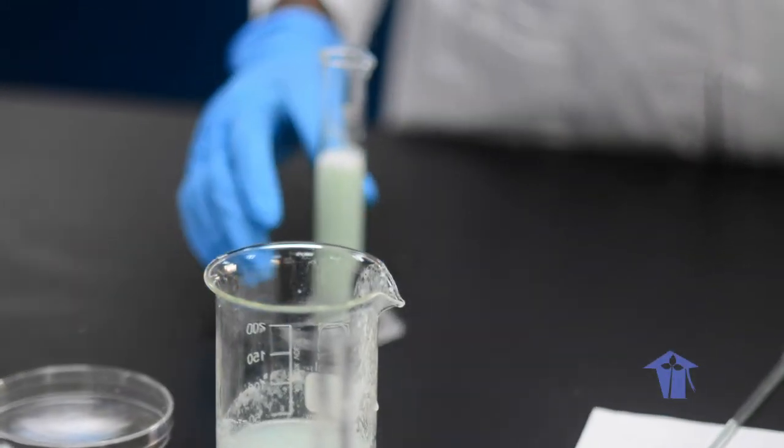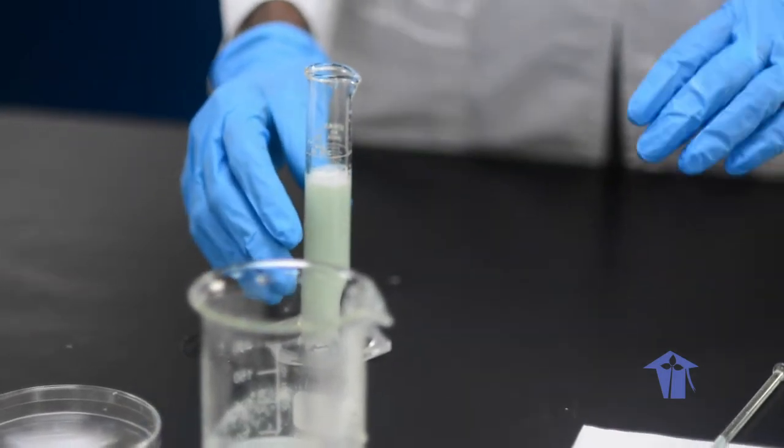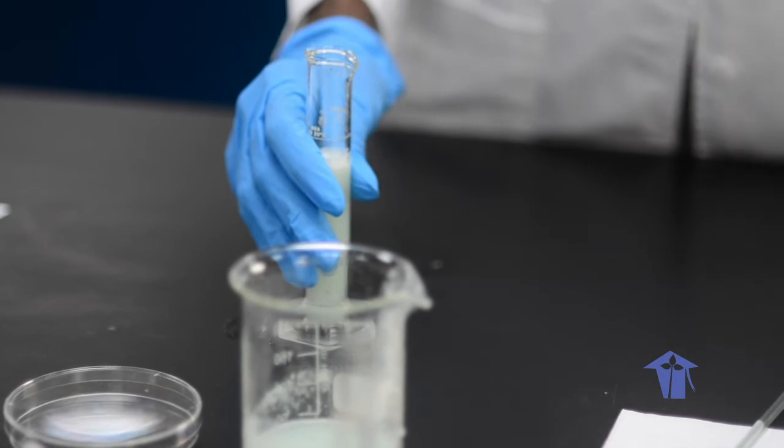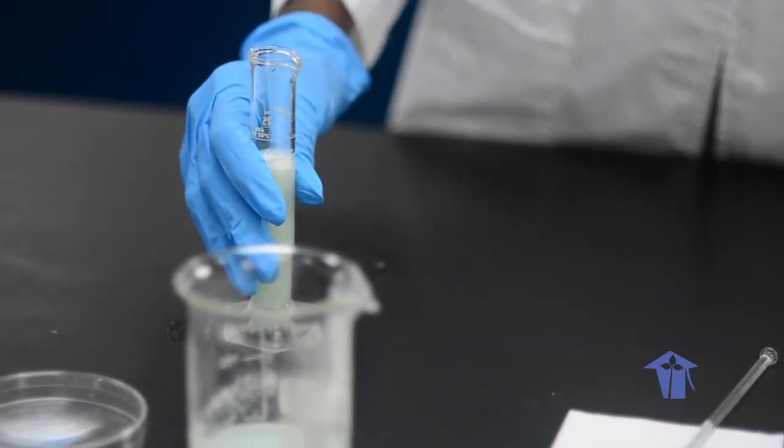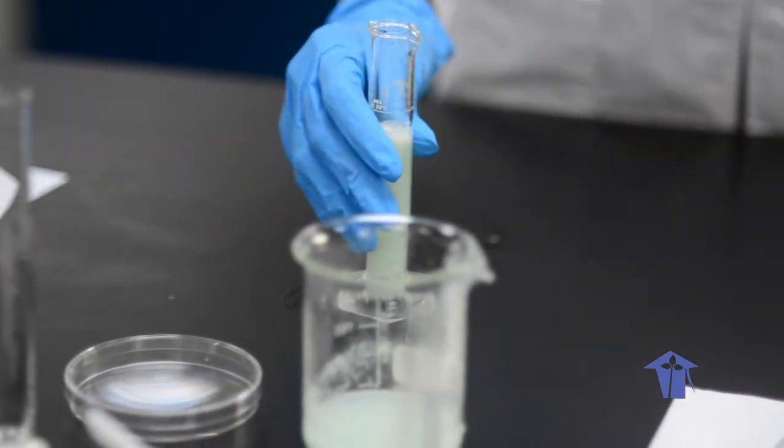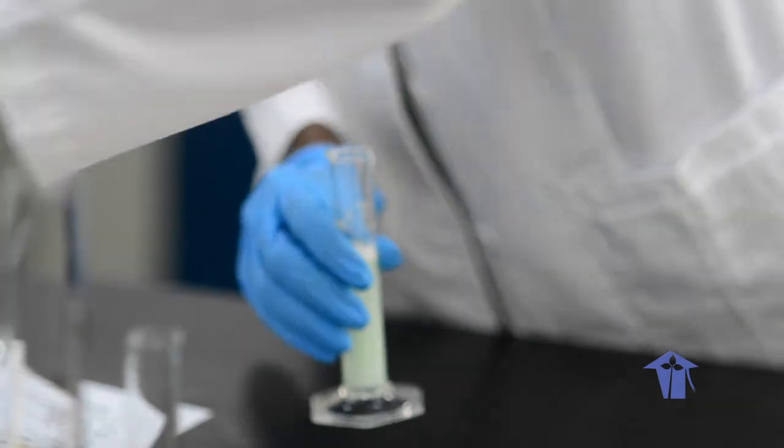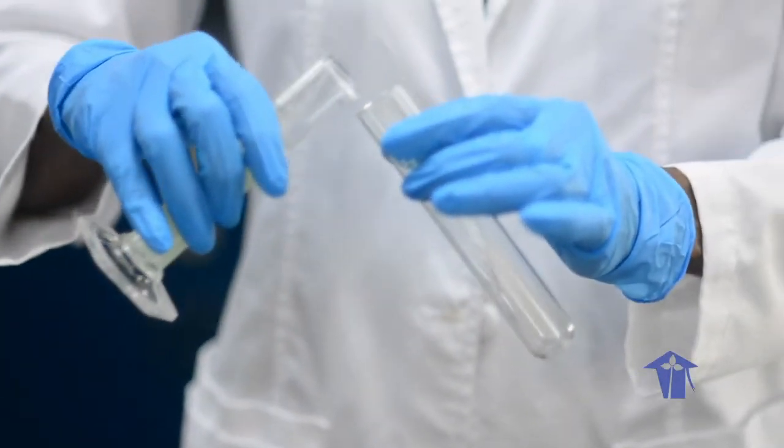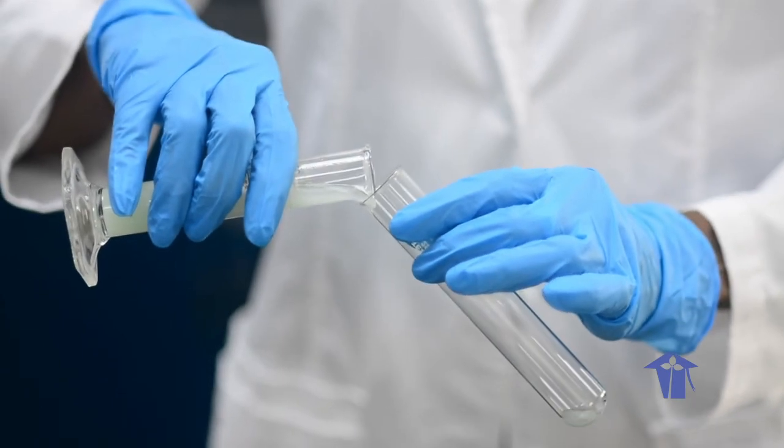Make sure in advance to read through all of the instructions so that you can collect the necessary pieces of equipment and the materials that you need. Now, to this, I am going to add this to a boiling tube or a large cup, pouring it on the side like that.